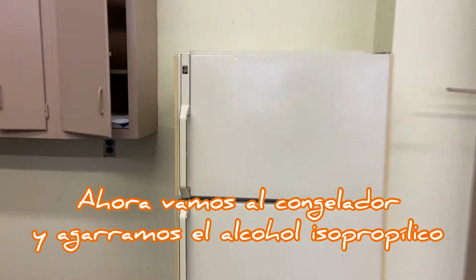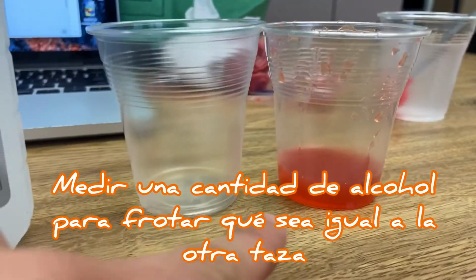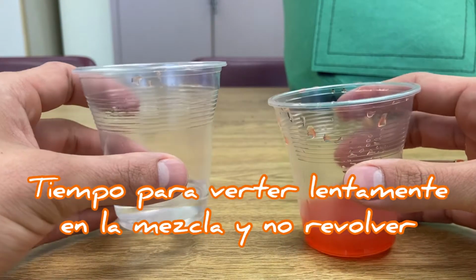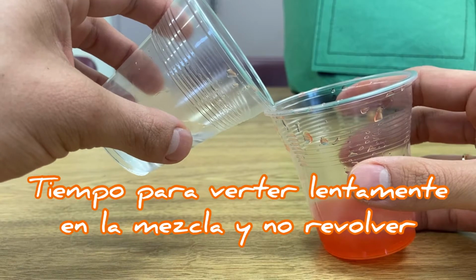So now, let's go all the way to the freezer. Grab our isopropyl rubbing alcohol. Come all the way back. And we're gonna measure out an amount that is the exact same height as that liquid. So now we will slowly pour the alcohol down the side of this cup, and we're not gonna stir or mix or blend or anything.